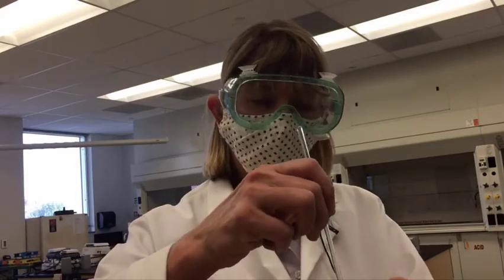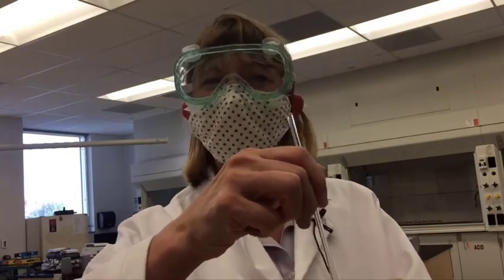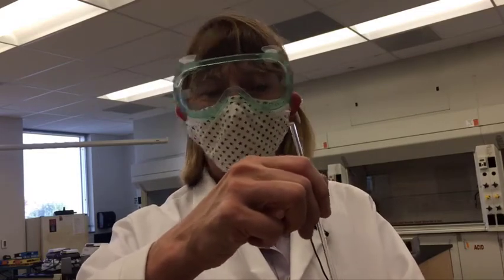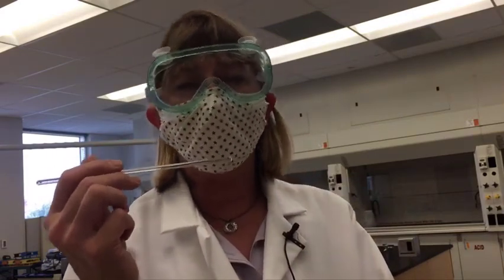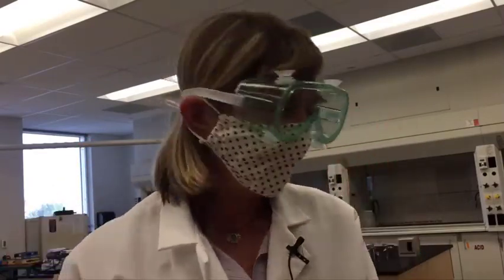In lab, one of the things we need to do is smell the solution. We will go ahead and stir the solution — some of these might take two or three minutes before a gas might be produced. Then you're going to smell the stirring rod as best as you can through the mask. We would take it and put the odor towards our nose, and if it's strong enough, maybe we can smell it. So we'll try that this week.